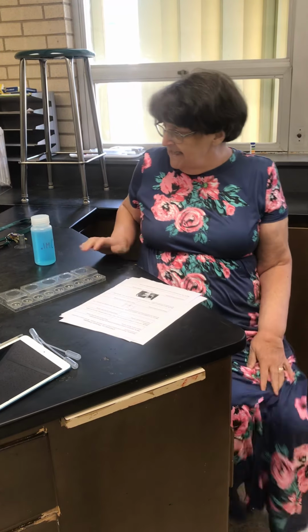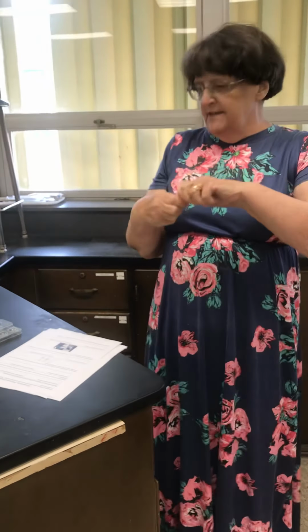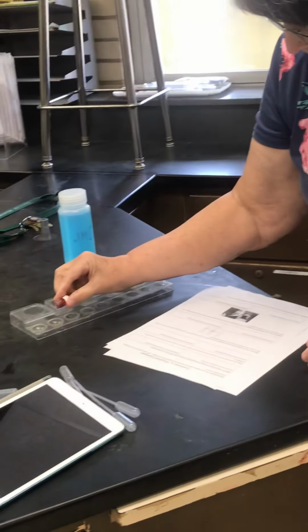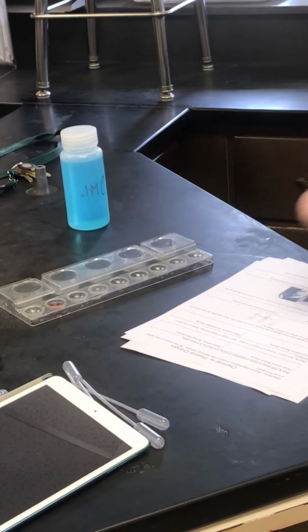Okay, we're going to do a lab on physical and chemical changes. You can find this lab in your Chromebook assignments under labs for chapter 9. So we're going to start by taking some cobalt chloride, which I made especially for us, and I'm just going to put a little teeny bit right there. Come on, come out. There we go.